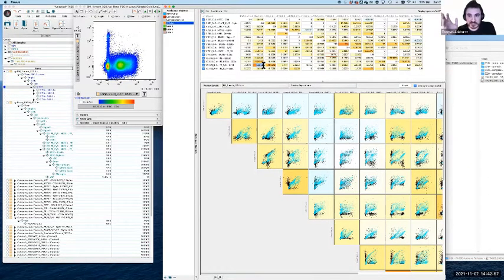I will say though, unless you're doing very large panels, it's unusual to come across compensation values of 100 or above. Normally that happens when you're really packing fluorophores into the spectrum and you're running out of room. So it is worth considering it to be a bit of a red flag, like it tells you that, hey, maybe something's wrong here. But particularly in large panels, you can absolutely have compensation values above 100, and that can be okay. We'll have a little bit of time towards the end of the workshop where we can look at that in more detail if people are interested. But for now, if it's an average size panel, it's probably worth considering it to be a little flag that you should go check. But there's nothing wrong with having a value above 100.